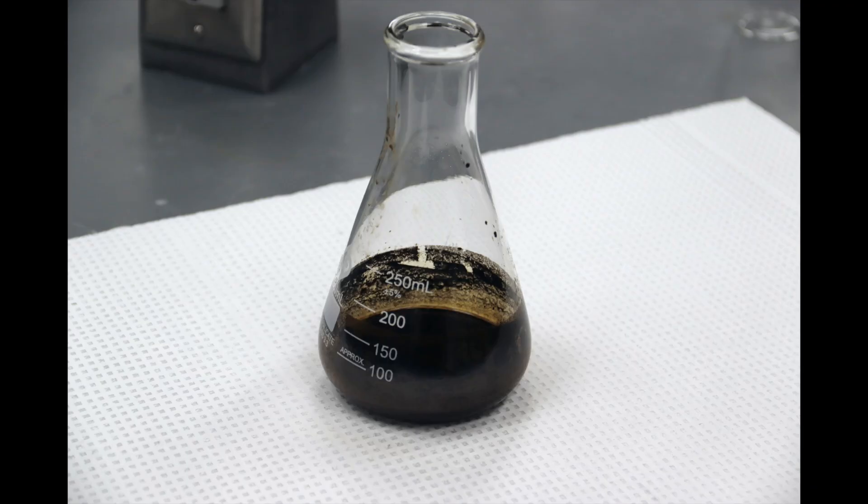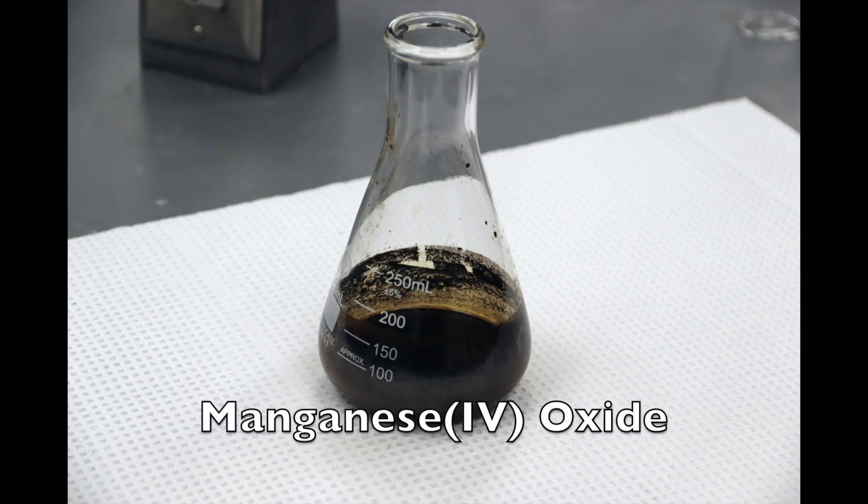In this particular mixture, we have an ionic product that is dissolved in an aqueous solution. But, we also have a solid impurity called manganese 4 oxide that is made up of very fine particles.